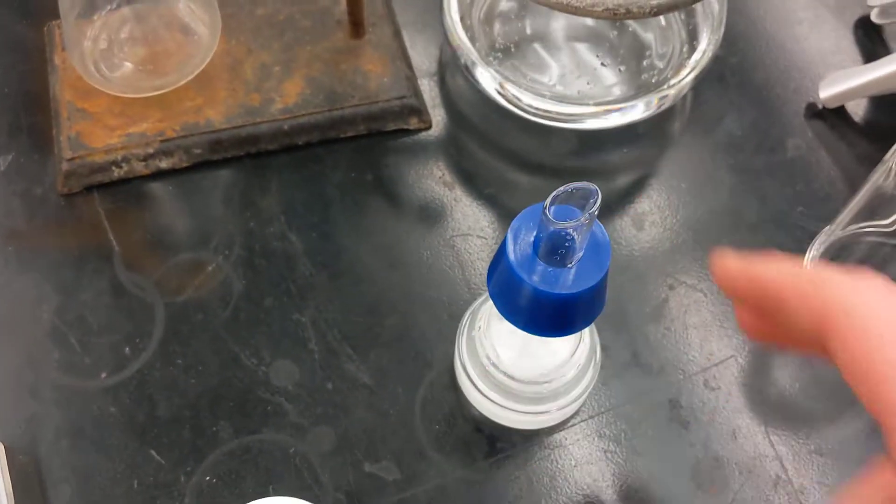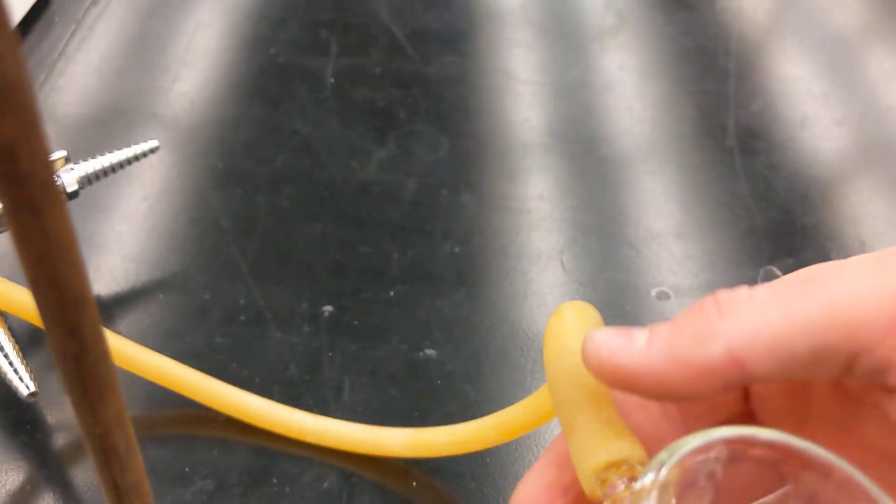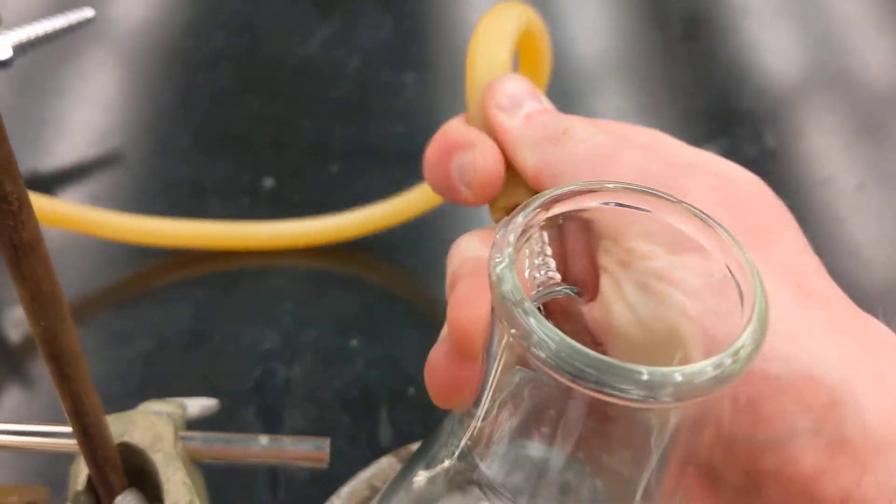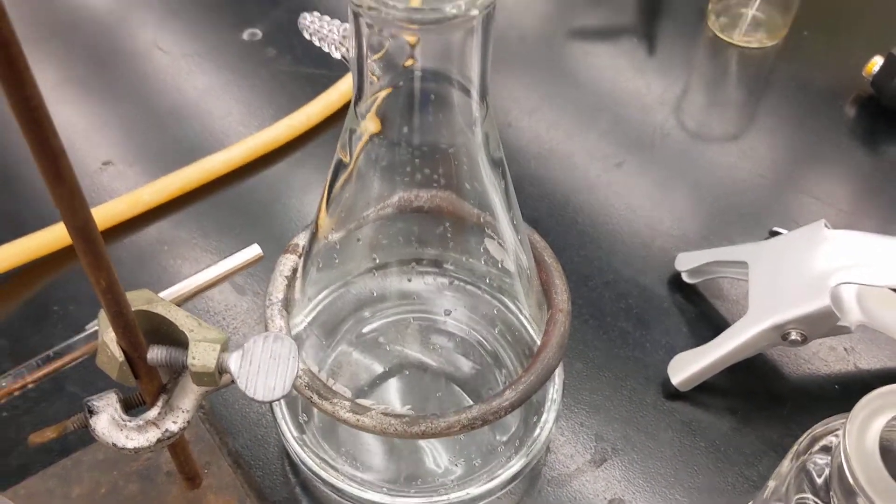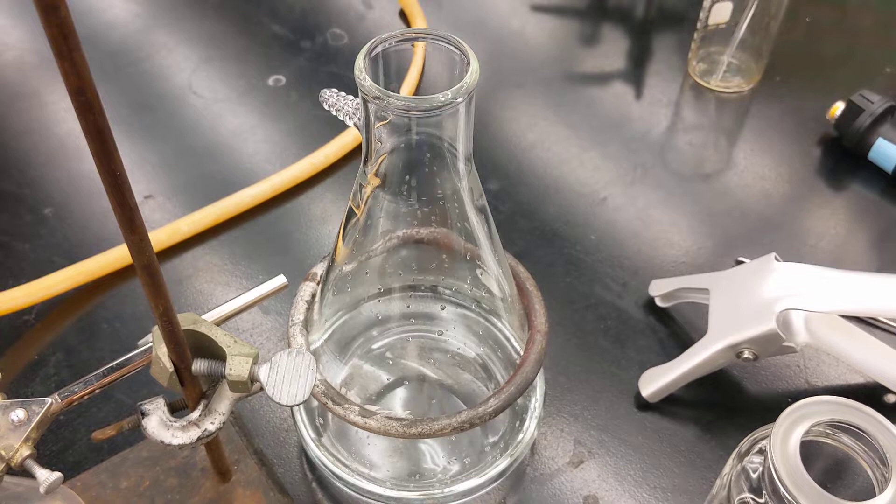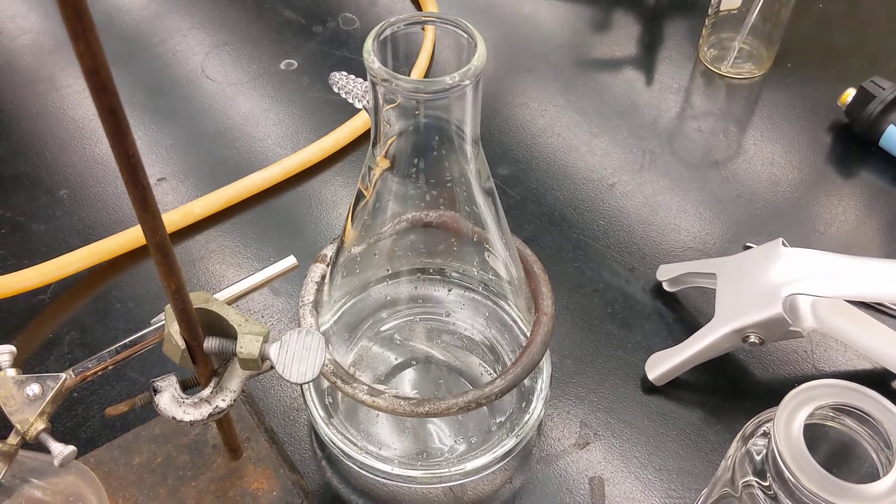Now you'll detach the line and remove and transfer your filtered water into a clean vessel for whatever you're going to use it for.